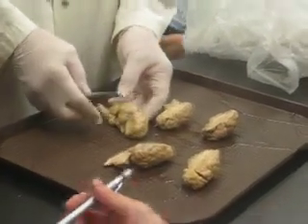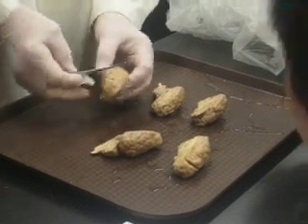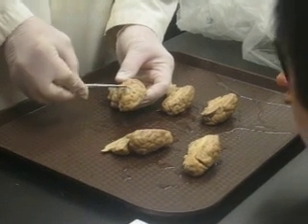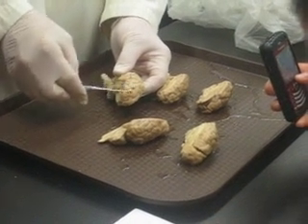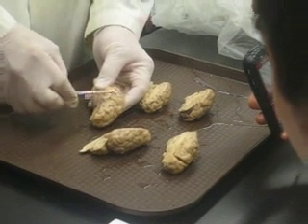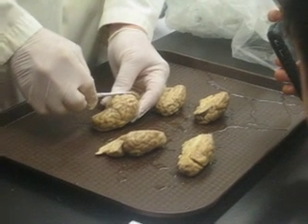Okay, you notice that the cerebral cortex of the sheep is not going to be designated and defined the same way that ours was. So all I've simply said was if you're looking at the very front part of the cortex, that would be the frontal area. It would be part of the frontal lobe, but there's no distinct central sulcus that's going to give us a boundary to it. So this area we would classify as the frontal area. The middle portion here we classify as the parietal area, and the back portion would be the occipital area. So they're just basic regions.